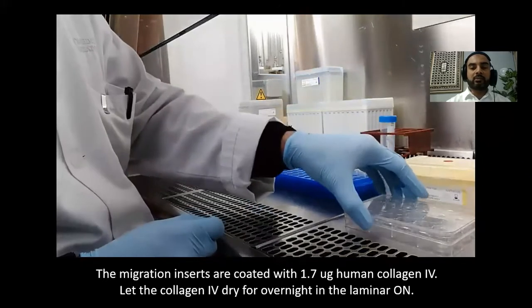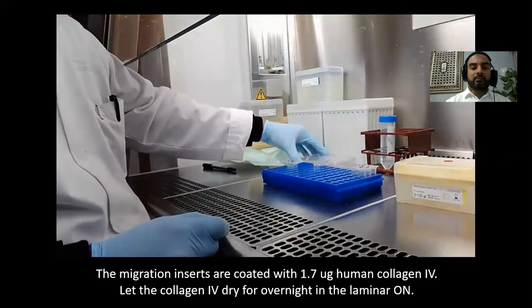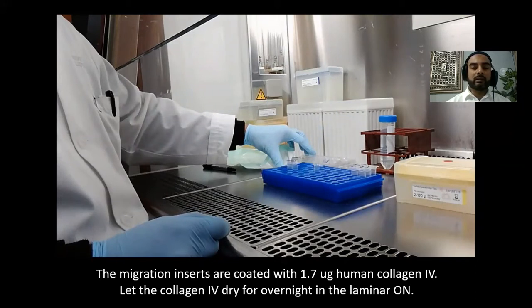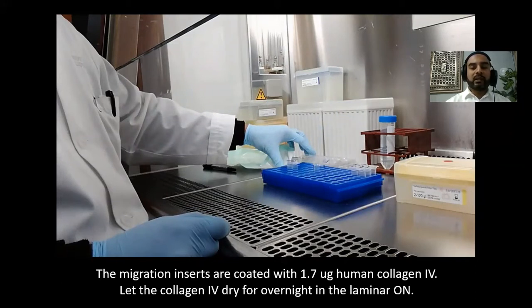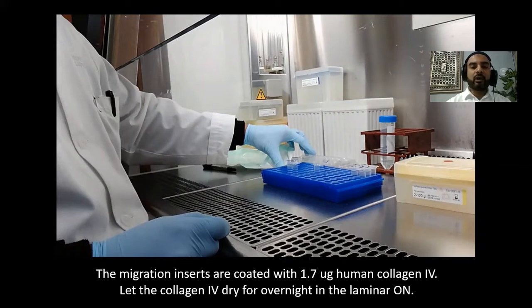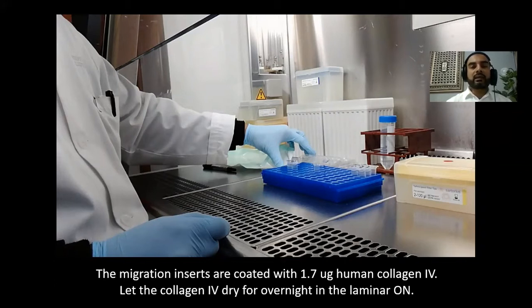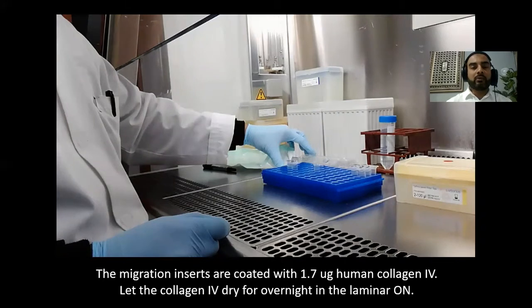In the migration inserts, we are coating with collagen IV. Collagen IV is the basic component of connective tissue, so here we are mimicking the same conditions as in the body. The cells will produce enzymes which will digest the collagen IV and then migrate. In this way, we are recording not only the migration of the cancer cells but also determining their invasive potential.